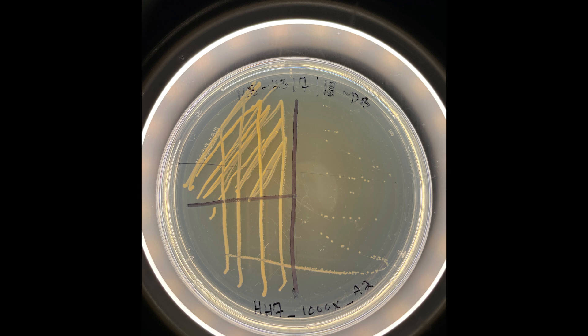Don't be too hard on yourself if you gouge the agar using the toothpick method or even with the inoculating loops. You are learning and it does take time and practice to kind of finesse these techniques.